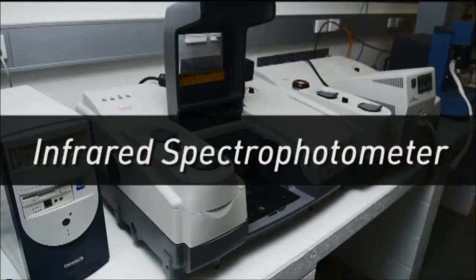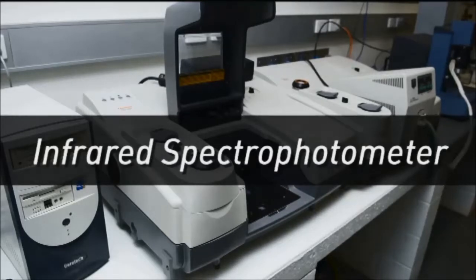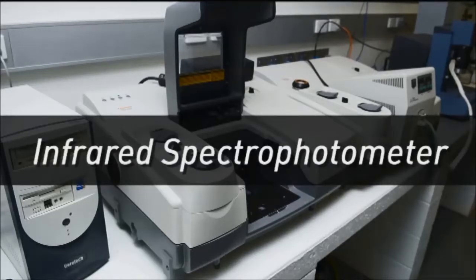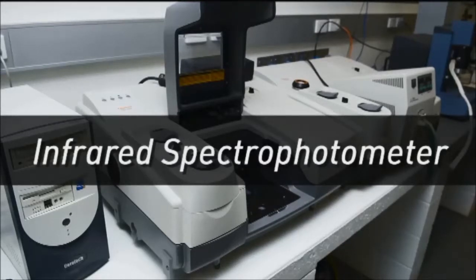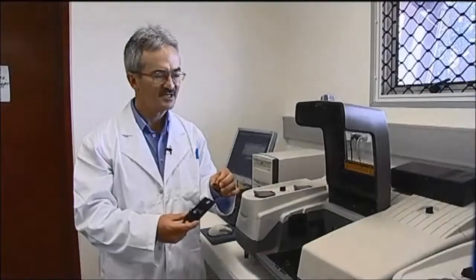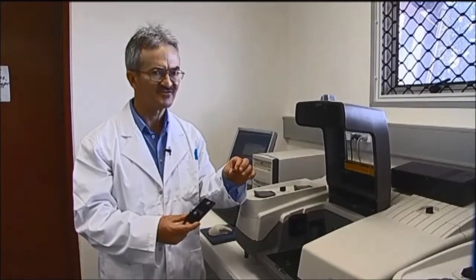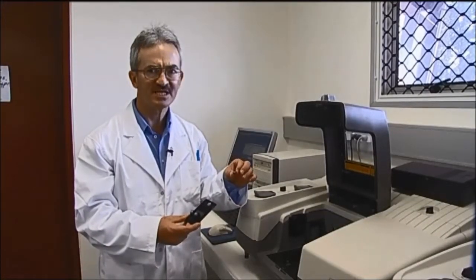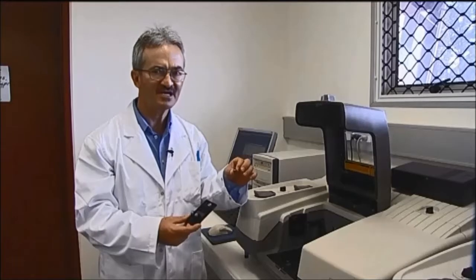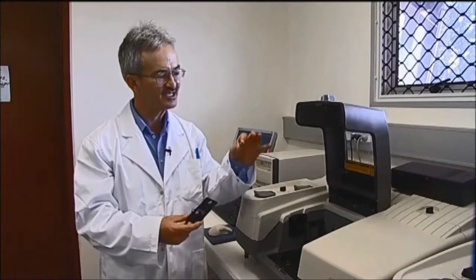The infrared spectrophotometer determines the chemical composition of a liquid or solid polymer sample. Here we have the infrared spectrophotometer, which allows us to identify the chemical composition of the polymeric sample.